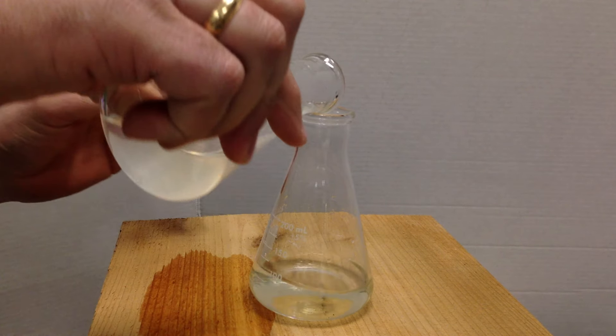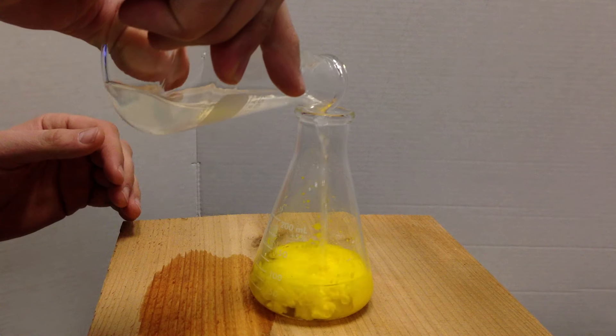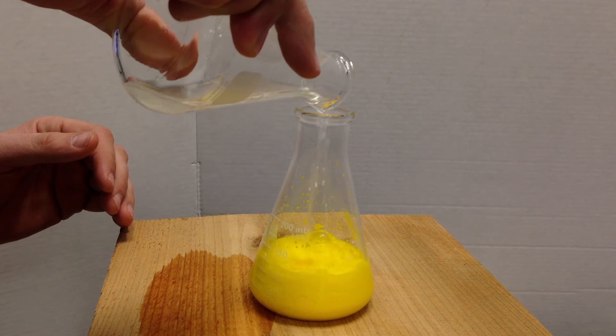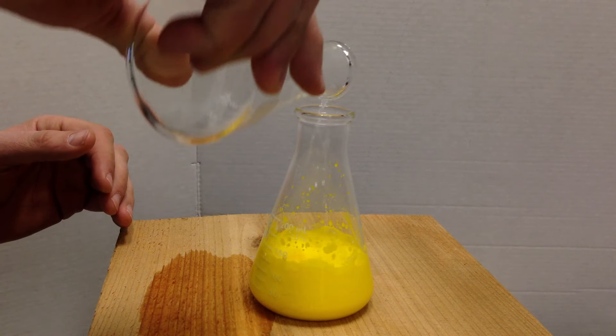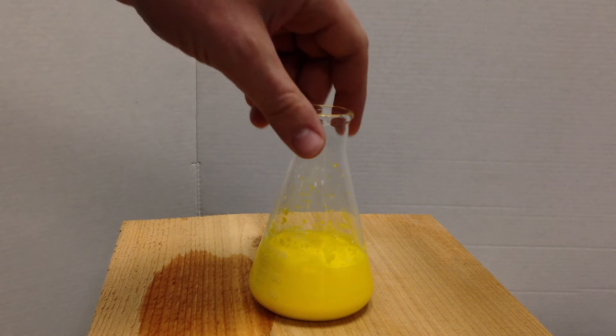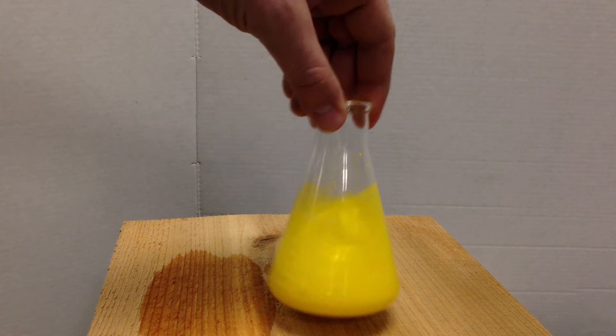Here we go. Very brilliant reaction. You see that it's very pretty yellow precipitate.